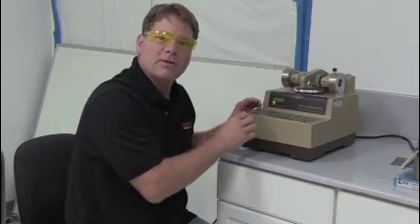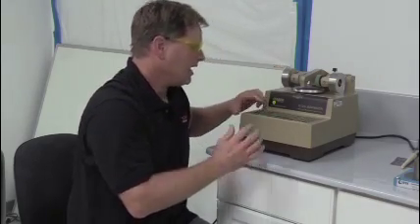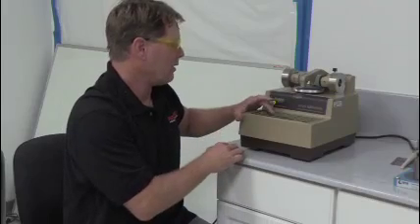So now you select the number of cycles that you're going to perform. We're going to do a thousand and I'll show you what it looks like and how it runs.